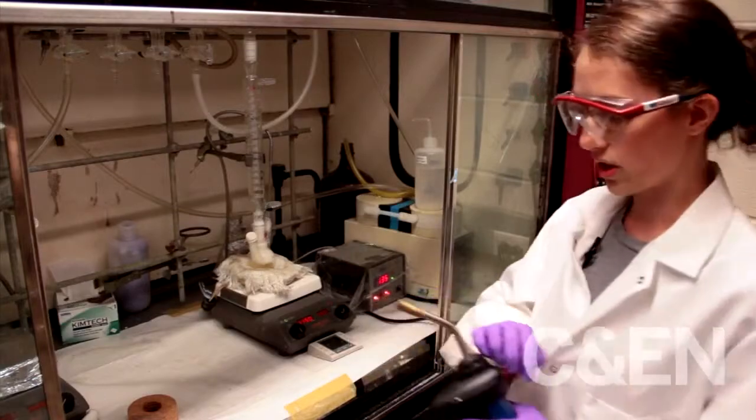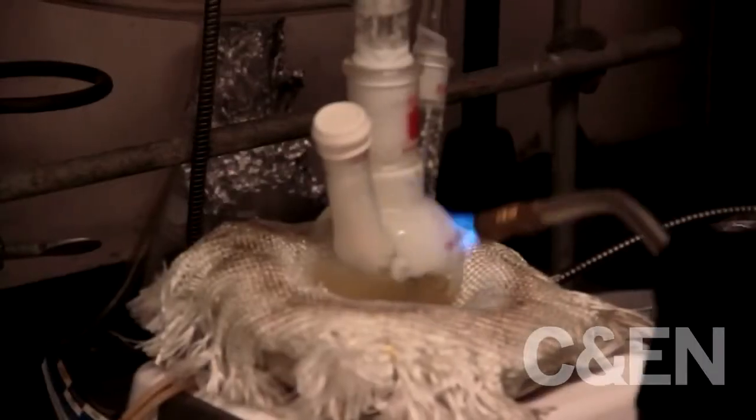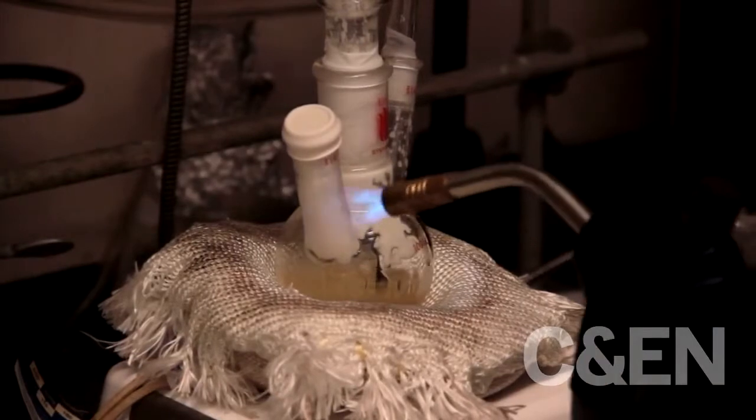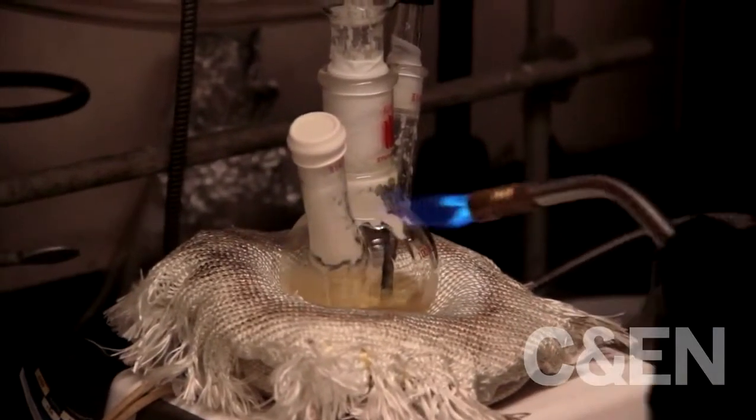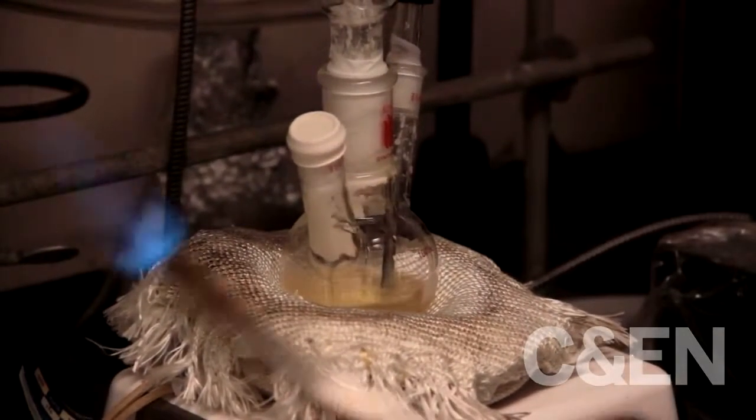So I'm just going to use a handy blowtorch. And you can see as I'm heating this up, it's falling back in. I don't want to heat it up too much, so try to go slowly.